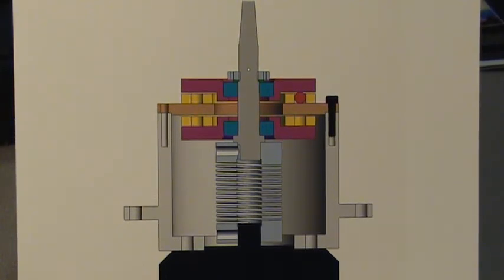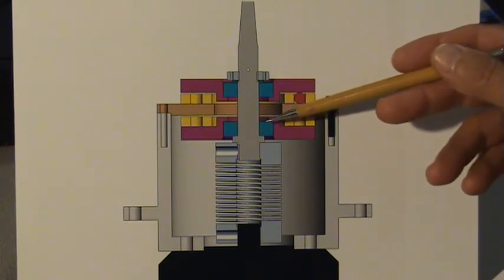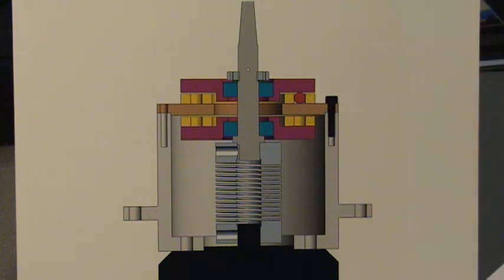In spite of demonstrable rotor balancing advantages, Rotor-Mate technology would be of little commercial interest if it were complicated, expensive, or unreliable. This is a cross-sectional CAD view of the patented mechanism. Shown is a standard commercial drive motor, a housing which could be plastic for light-duty applications, a commercially available OEM flexible drive coupling, a metal support plate shown in orange here, 2 OEM Conrad ball bearings, and 2 plastic bearings supporting the rotor and providing frictional damping as needed.